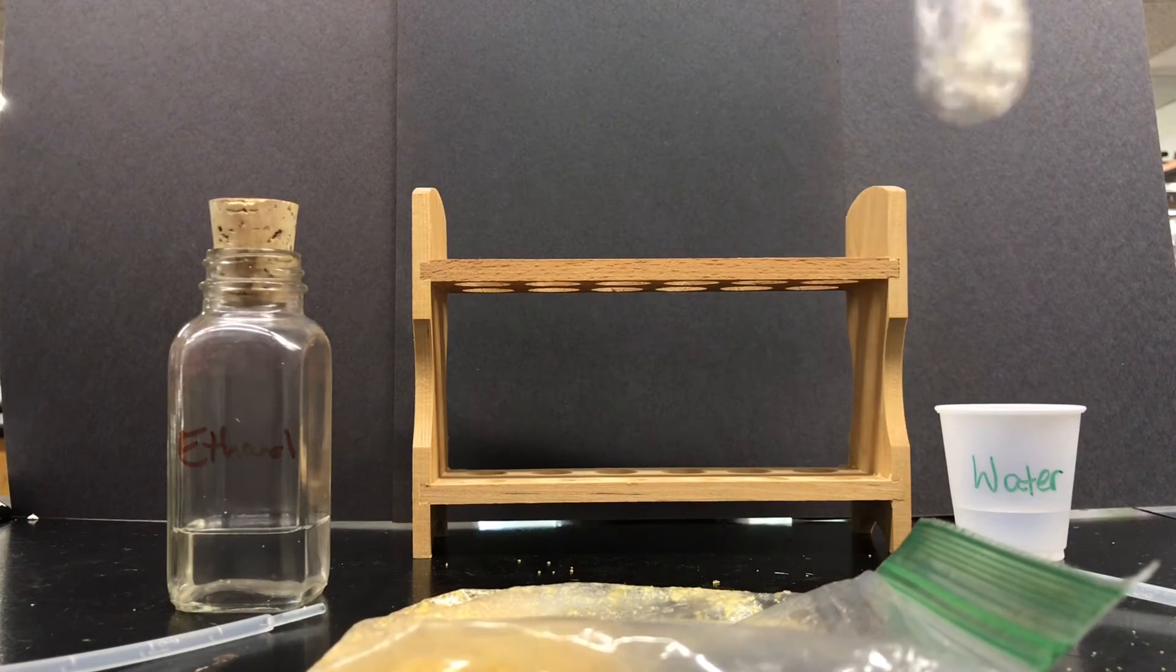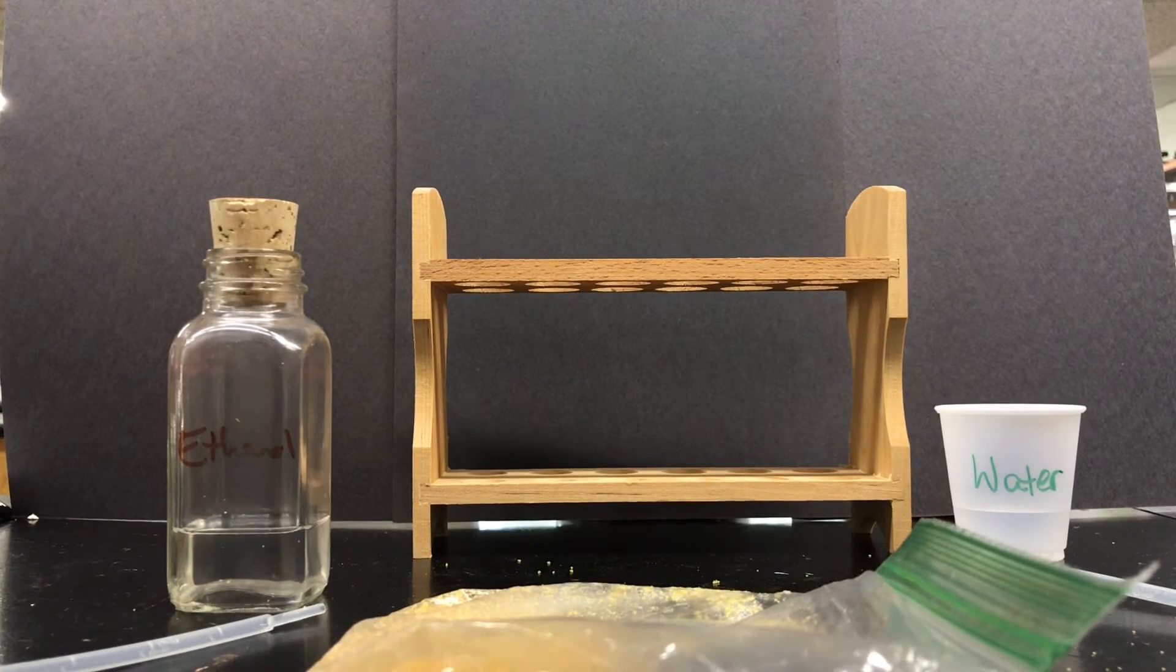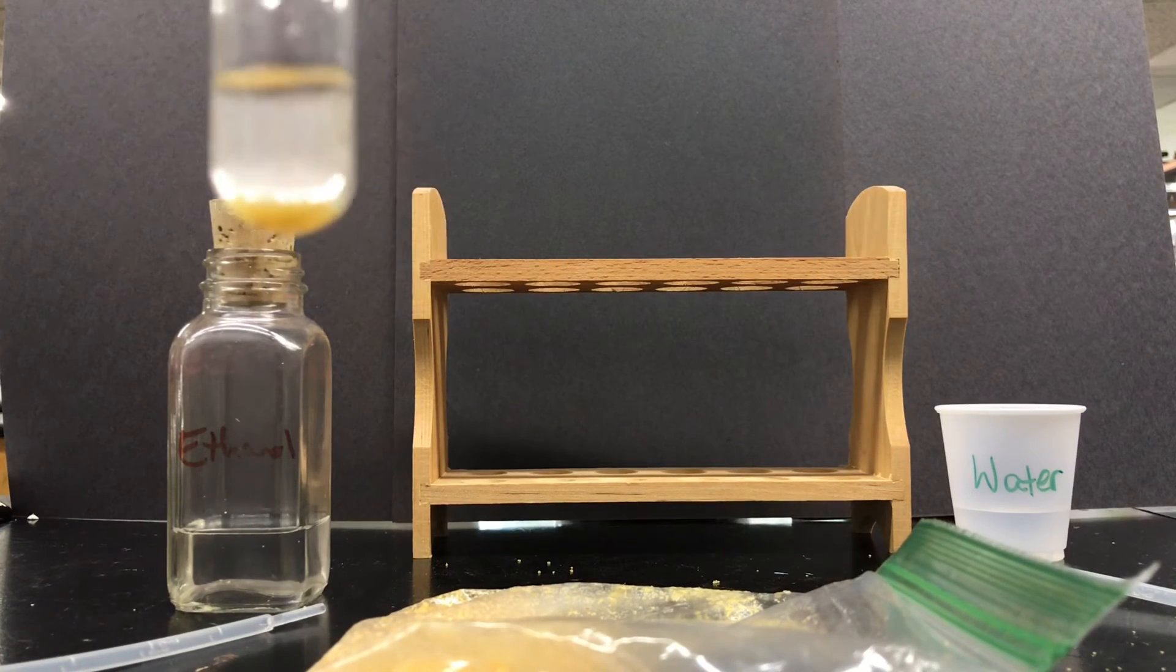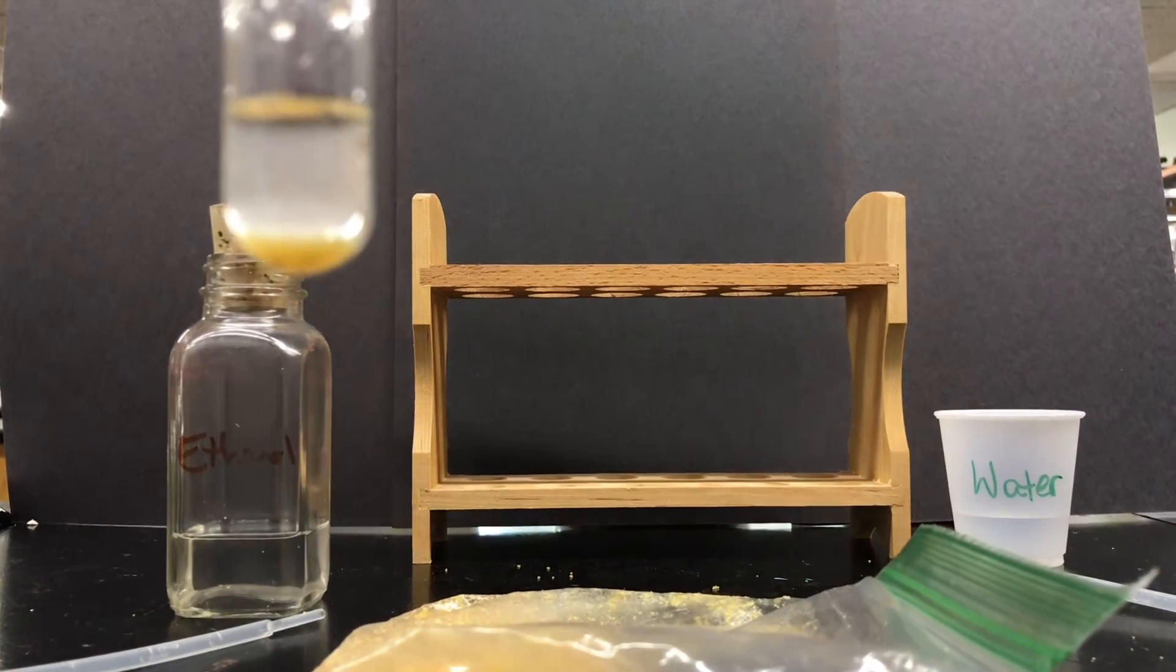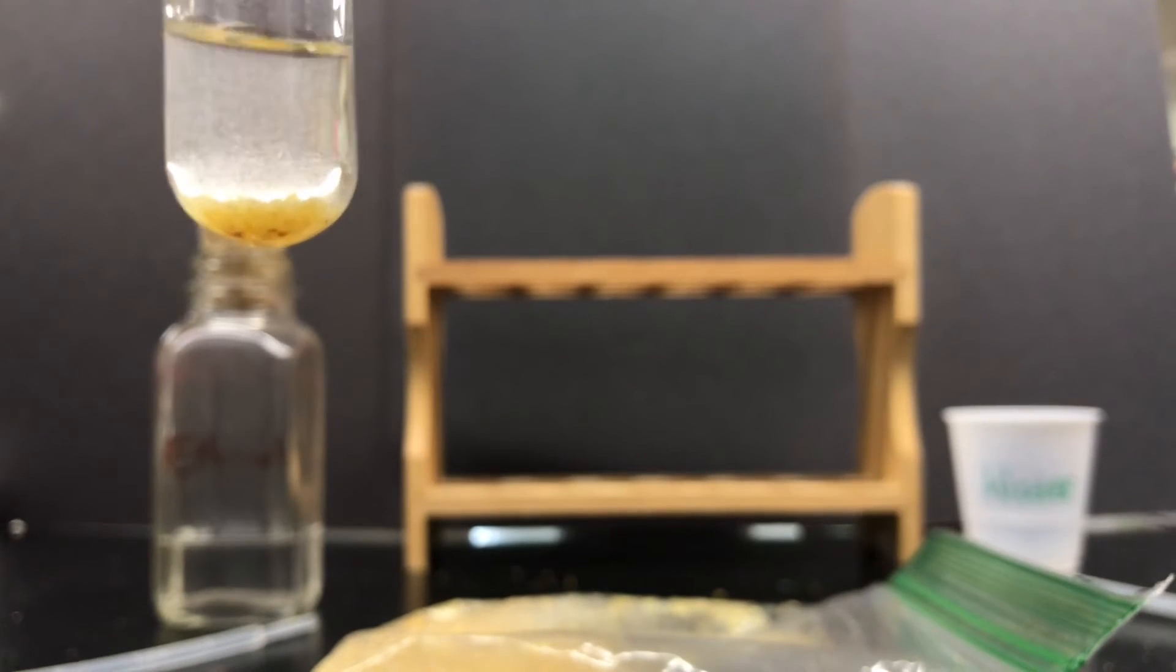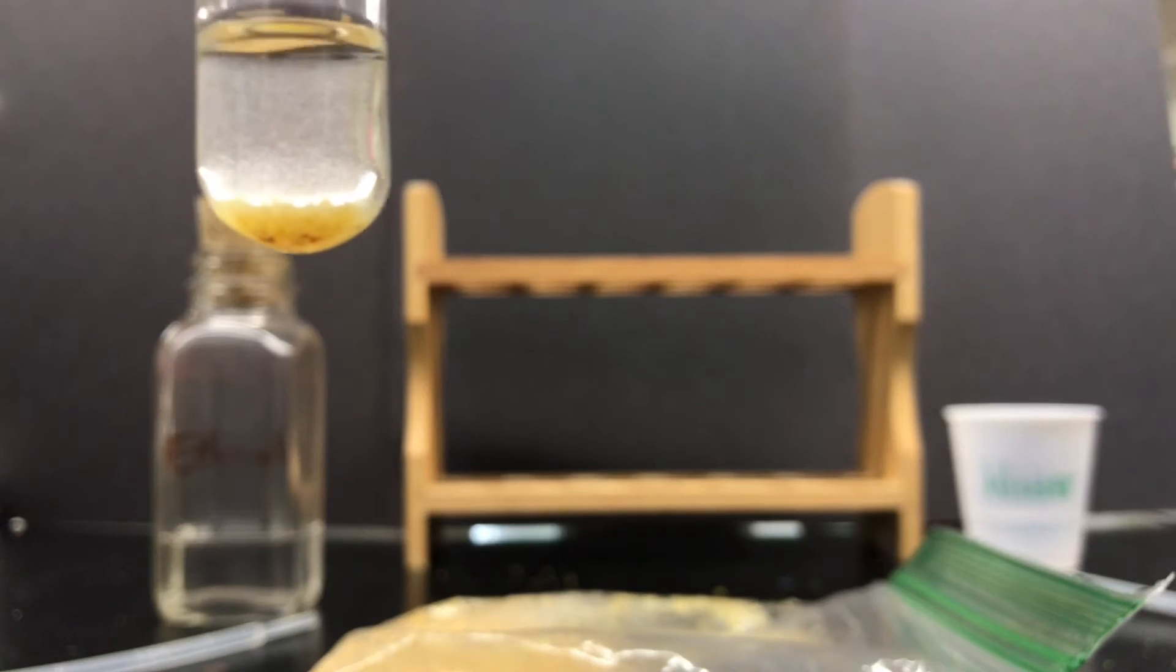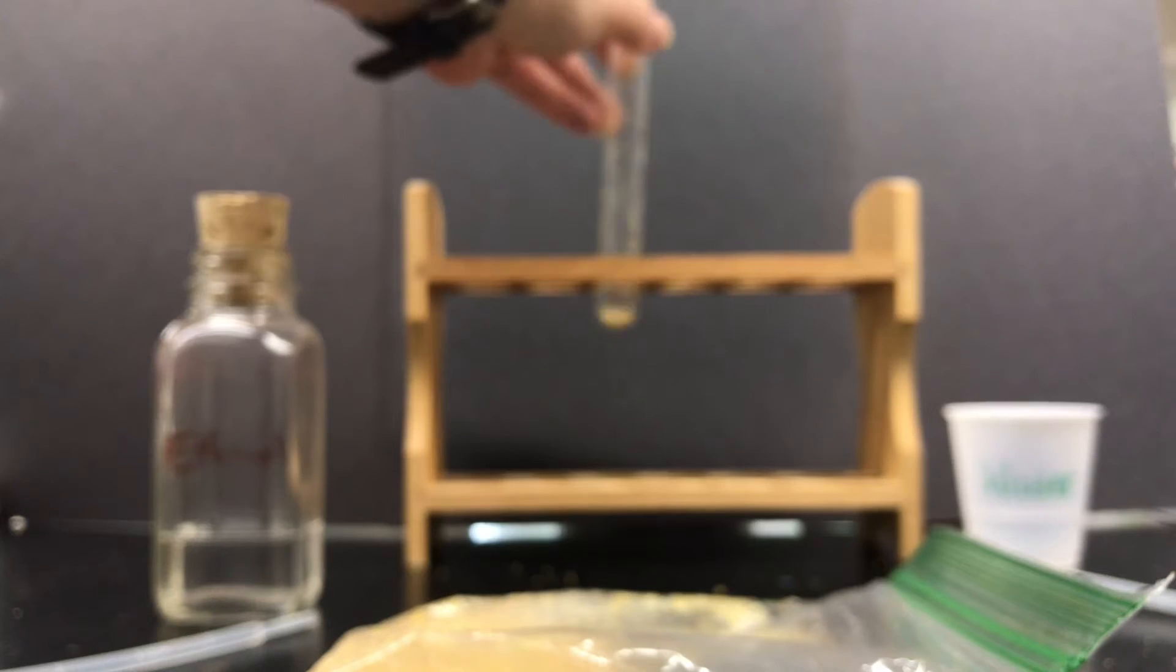All right so we're going to place this back down. Well as you can see our ethanol is relatively clear it's a little cloudy but not much. So place your test tube back on the test tube rack remove your stopper.